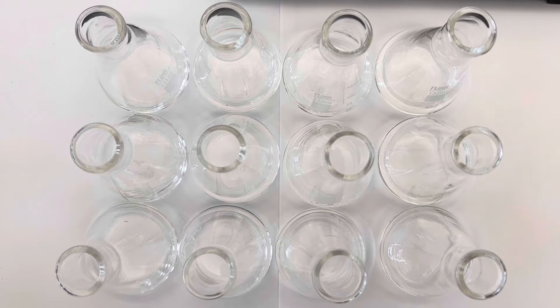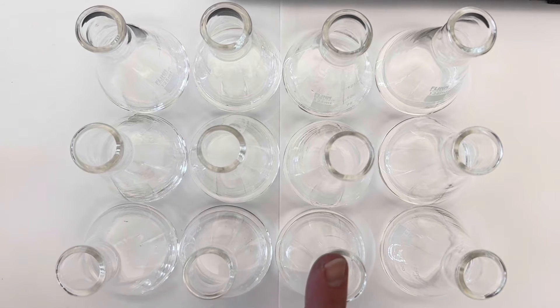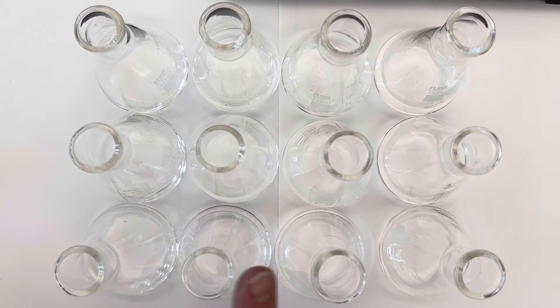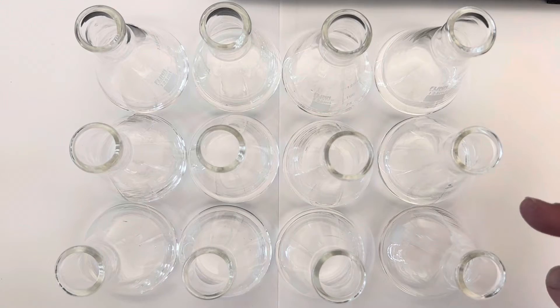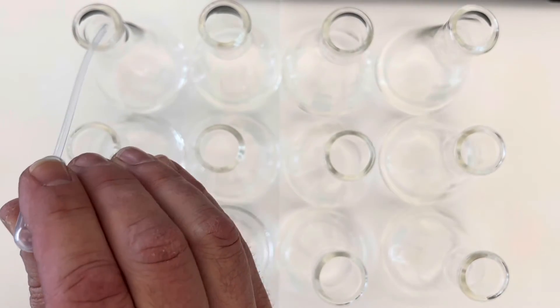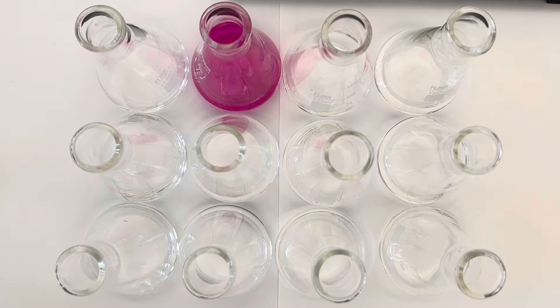I have some colorful indicators that we can look at. My setup is a bunch of flasks, and in the first and third columns, I have some sodium hydroxide solution — dilute, but it's fairly basic. We're going to start with phenolphthalein, which in acidic solution is clear, but in basic solution, it's that bright pink color.